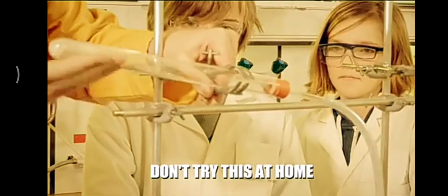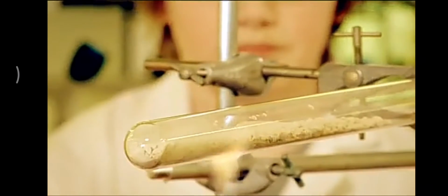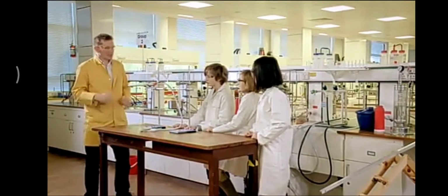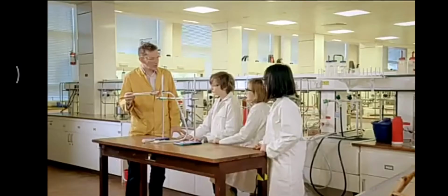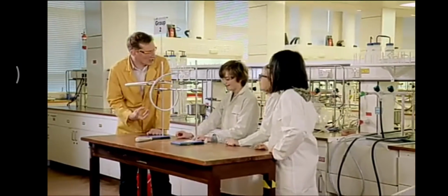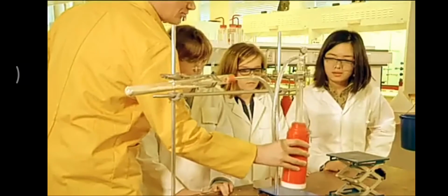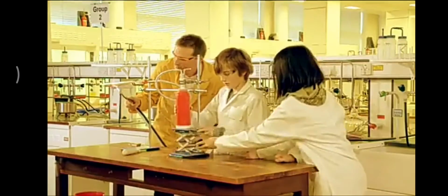Inside our test tube, we've got our calcium carbonate rock. That contains calcium, carbon, and oxygen. And shortly, I'll be testing my apprentices to see if they know what it's made from. We're going to try and collect some of the carbon dioxide. We're going to force it out of the calcium carbonate, okay? And we want to see if we can trap it. Now, how do you think we can do that? Liquid nitrogen. We could use some liquid nitrogen, and that would cool it down and convert it into the solid form. Okay, so that's what we're going to do. Using freezing liquid nitrogen, we can cool down our carbon dioxide gas as it's produced. This will change its state into a solid and capture it in a test tube before it can escape.